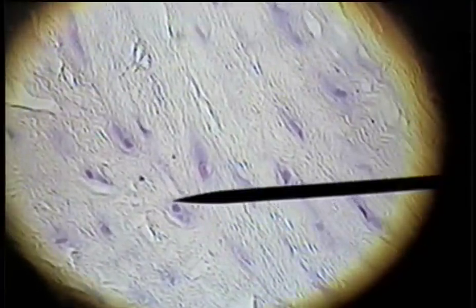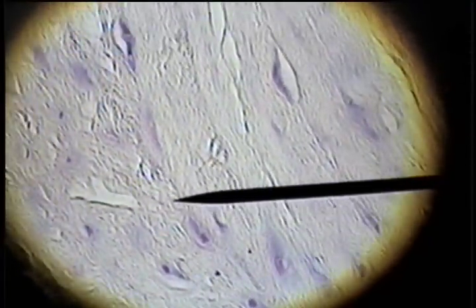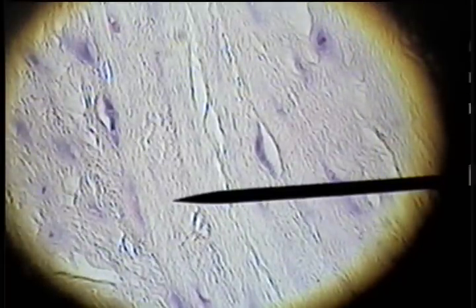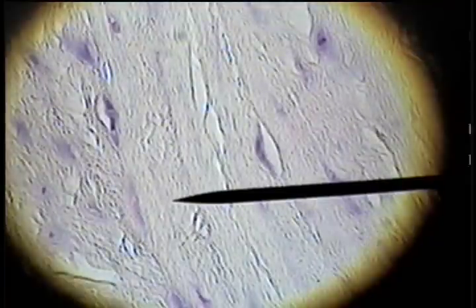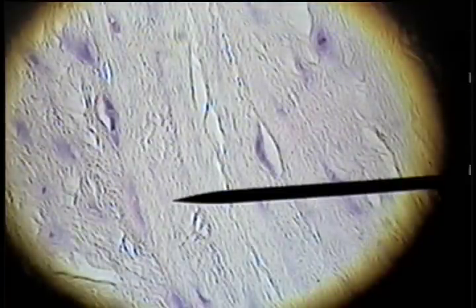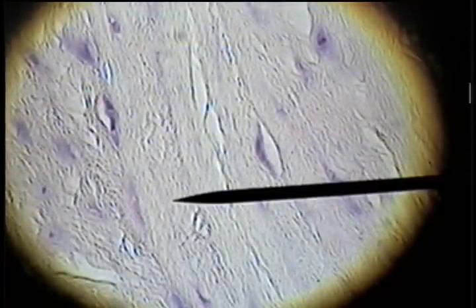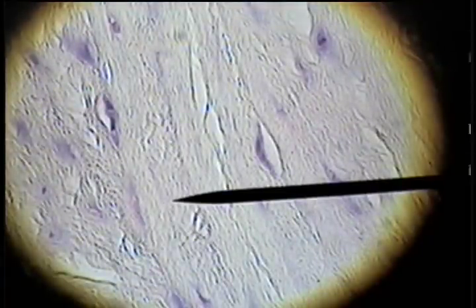These are the lacunae in a linear array among the tough fibrocartilage fibers in the ground substance of fibrocartilage — lacunae with chondrocytes of fibrous cartilage.